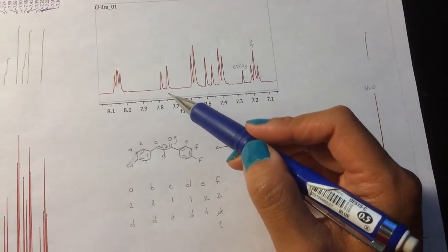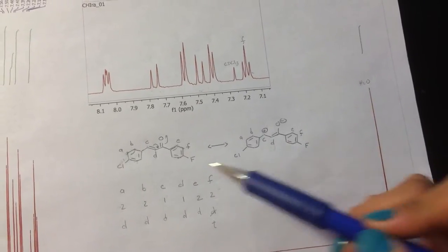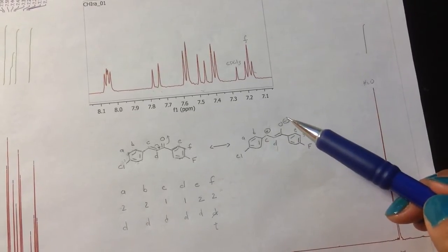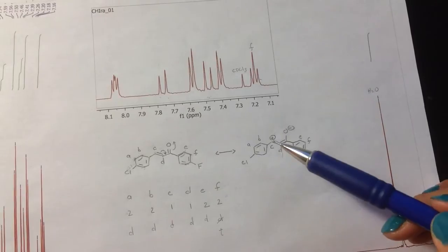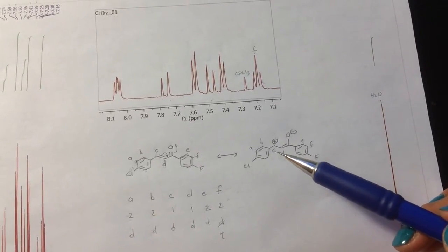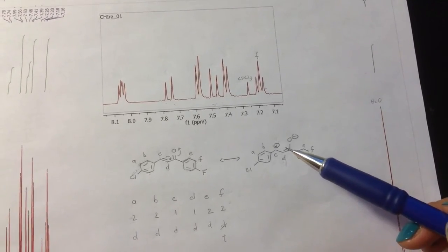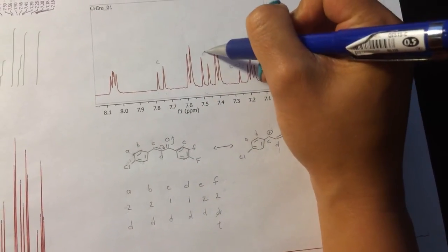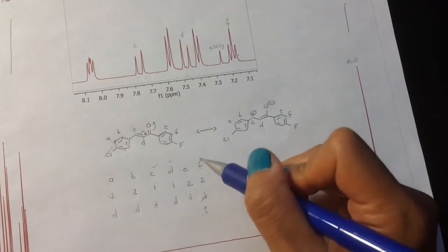The information that you can use is that resonance structure that we drew in pre-lab. And so remember, you can push these electrons to make that enolate resonance structure where you have this positive charge that sits on this carbon. And what that does is that de-shields that proton that's sitting on there, and that makes the peak go further downfield because it's feeling that magnet more. So this guy here is going to be assigned as C, and this guy here is going to be assigned as D. All right, so now we have C, D, and F done.